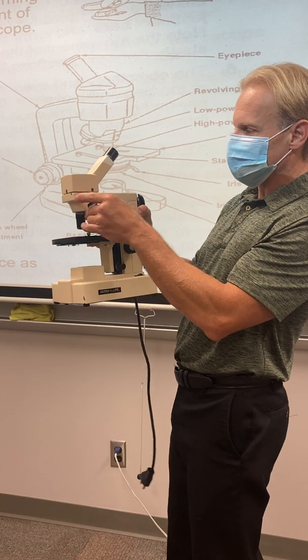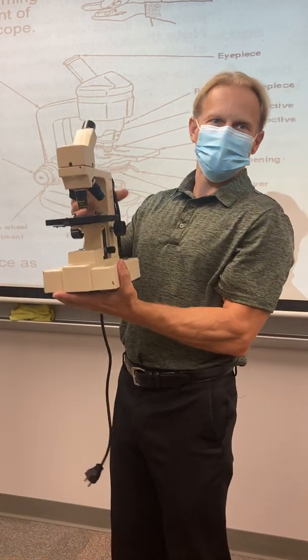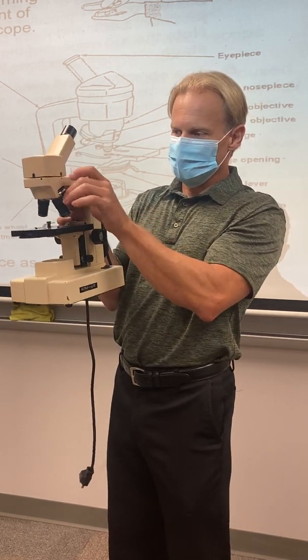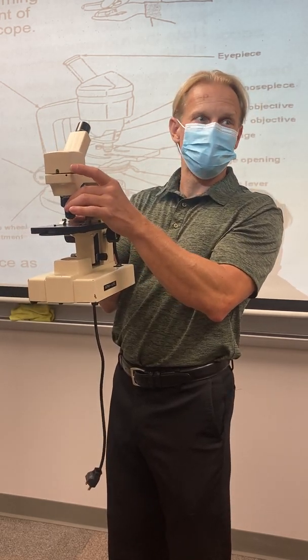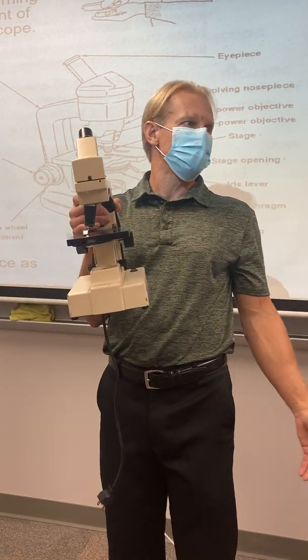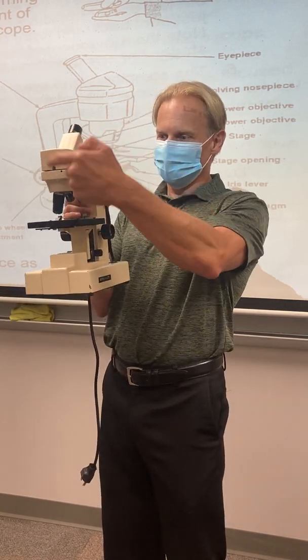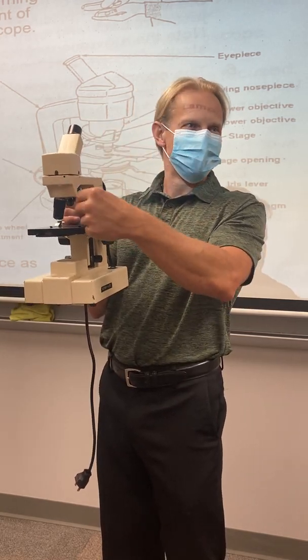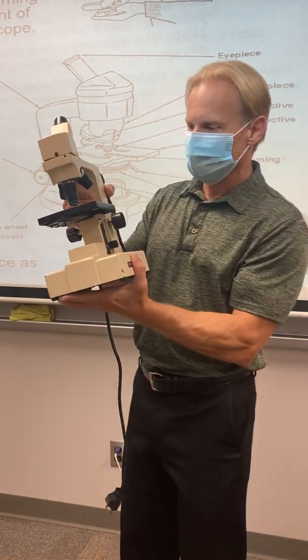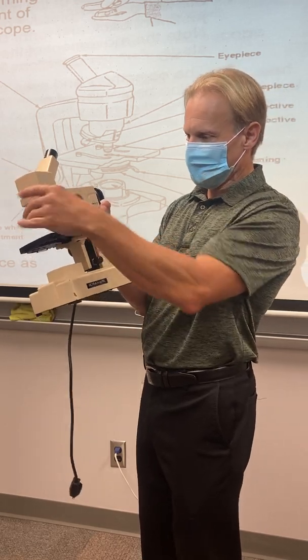So the revolving nose piece has the lenses on it, the objective lenses, and these change the magnification of your scope. Now it's really important that when you turn these things, they actually click in place. You'll feel it. If you're halfway in between, I guarantee you'll call me over and say, I don't see anything, there's nothing there, it's just black. That's because you're virtually looking at nothing. There's nothing letting the light pass through, okay? So we'll come back to that in a second when we go over focusing, but these rotate, okay?